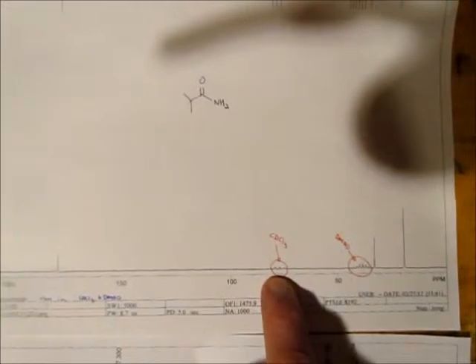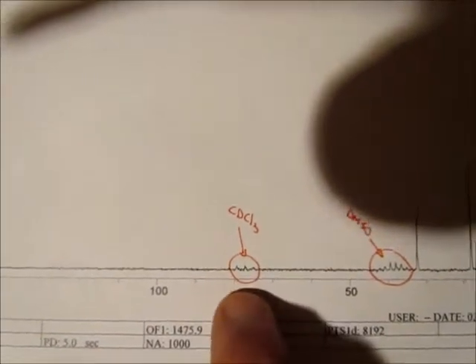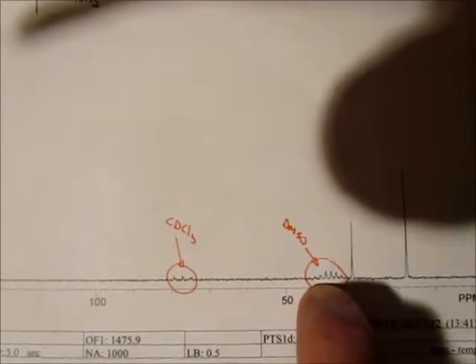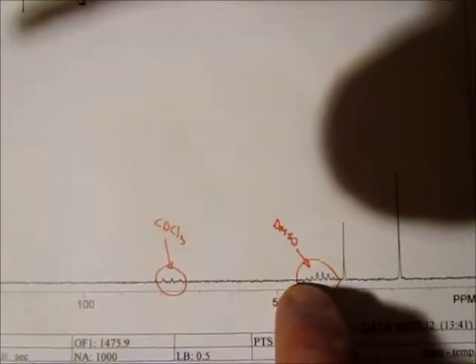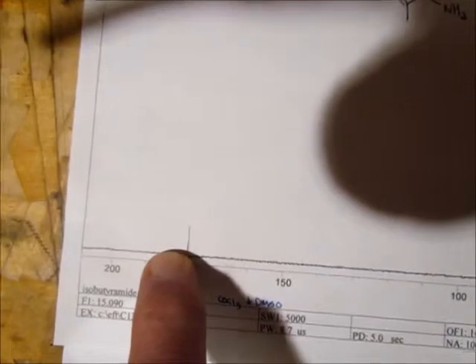And now we go to the carbon. In the old compound, this particular one has chloroform D at 77. We mixed it with DMSO to get it, so that's a DMSO solvent peak. The carbons is the methyl and then the CH group, methyl, CH group. And way over here at 177 is the carbonyl carbon. That was the old compound.